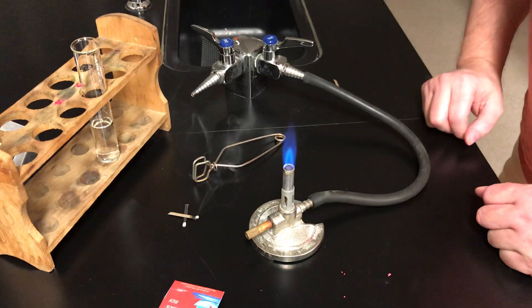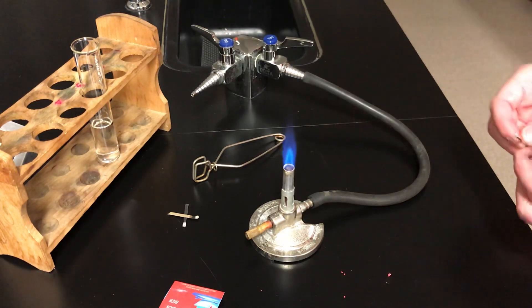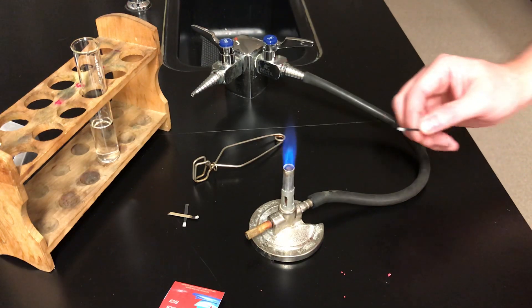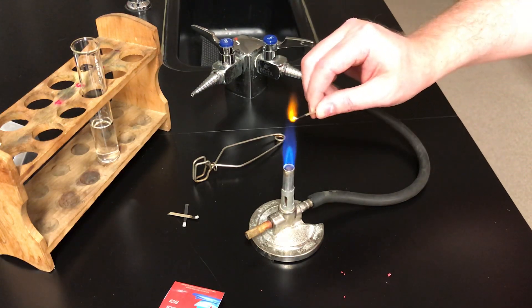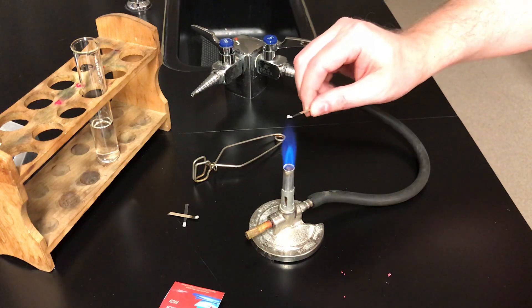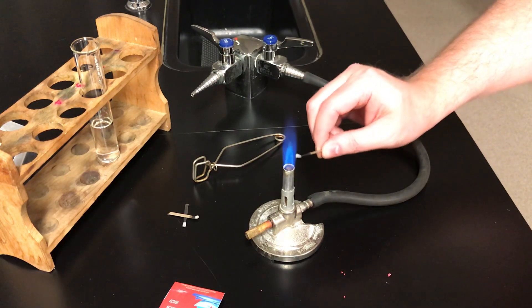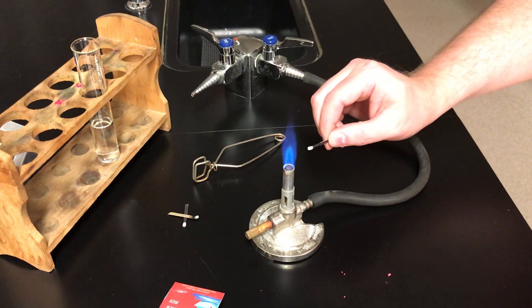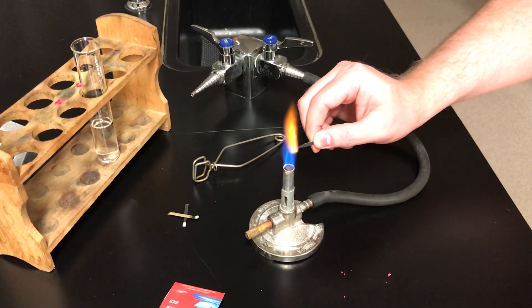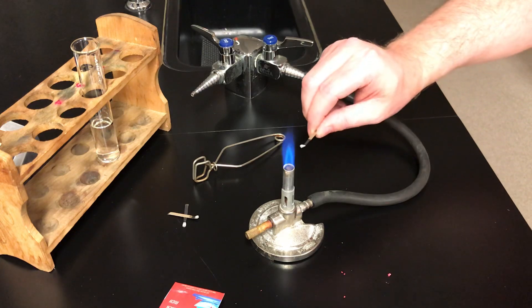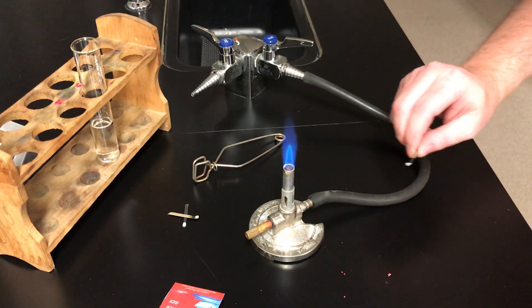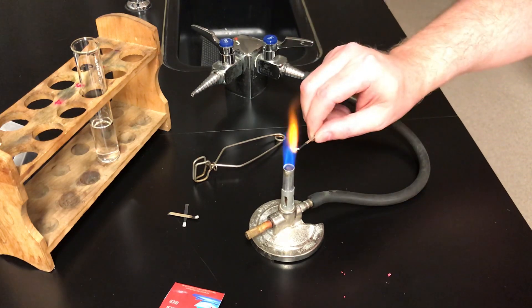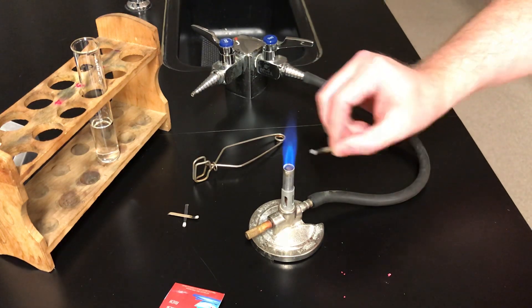There you've lit your burner. Now when you look at the flame, you may be able to see that this flame has some structure. It's an intense flame. The top of the flame up here is actually cooler than the point down here. You may notice there's an inner blue cone of flame. The hottest part of the burner flame is at the tip of the inner blue portion. So about midway in the flame is its hottest part. Not way down here at the mouth and not way up here at the top, but in the middle. At the tip of that inner blue cone.